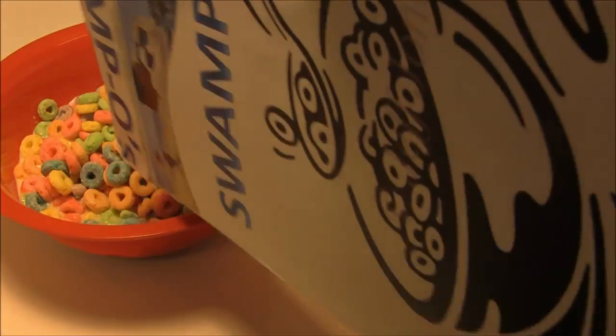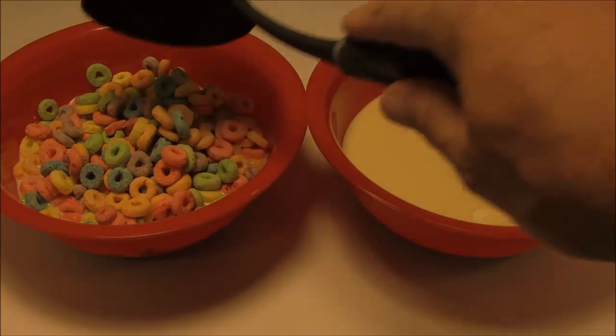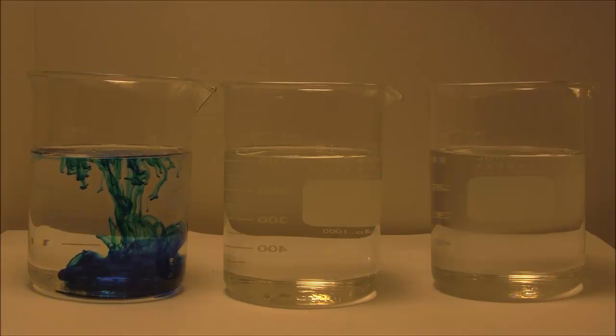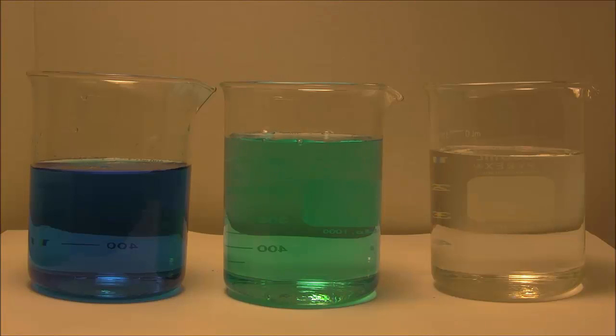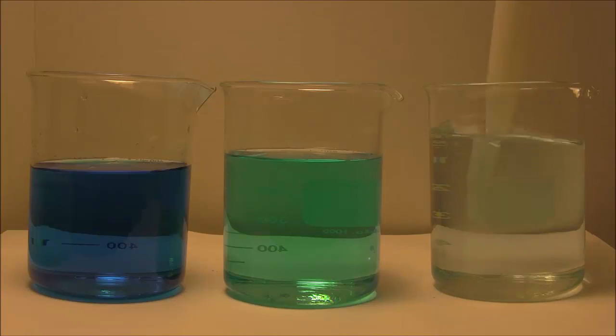Let's show you what a simple dilution could look like. Let's take a bowl with a heavy concentration of an unknown, and we'll take a subsample of that and put it into another vessel with a known volume of solution. Now we'll demonstrate a simple serial dilution, starting with a concentration in one vessel. We'll take a sample of that and put it into our second container that dilutes it, and then we'll take a sample of that and put it into our third vessel, which gives us an even further dilution.